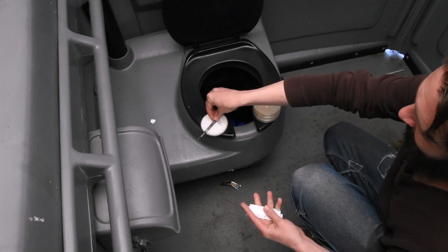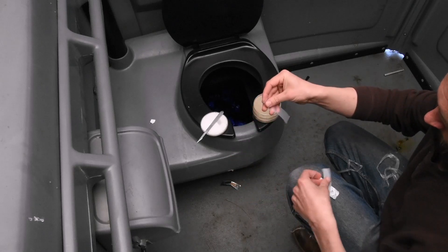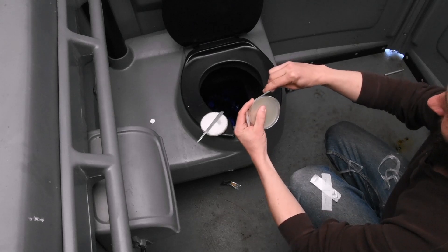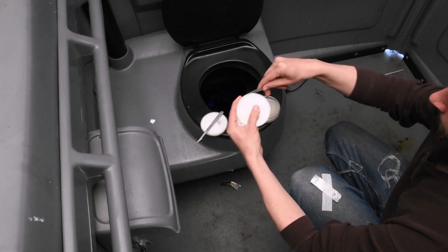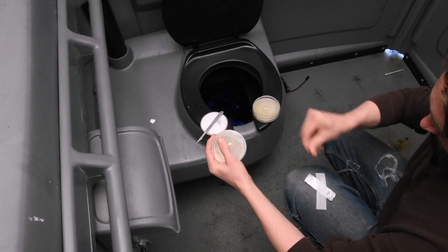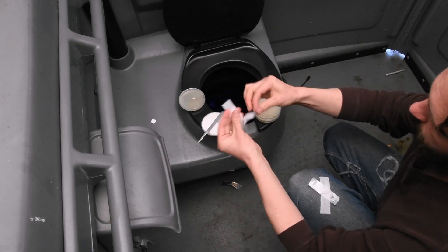And it looks like he's done. Oh wait, what is he doing? Parafilm — yes, he came prepared. Taping the plates. I don't have very good expectations for this. This looks like Contamination City. Could there be a worse place to do sterile technique? I'm not sure. If you have any ideas of worse places, let me know.